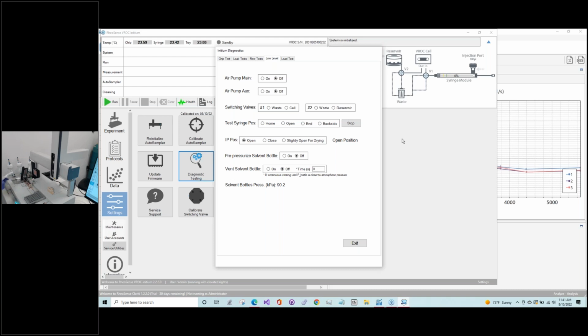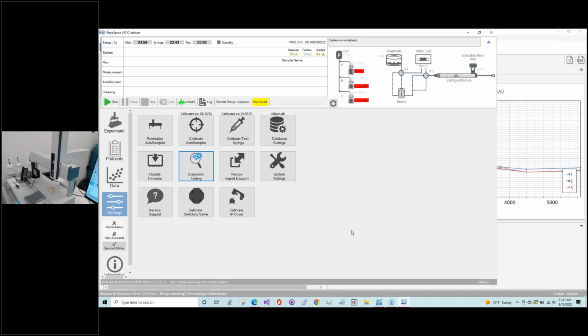Like we mentioned, once you've done that, even if it is just the piston, it's important to recalibrate the test syringe. And to do that, we're going to go to the calibrate test syringe, which is also under settings and service utilities.